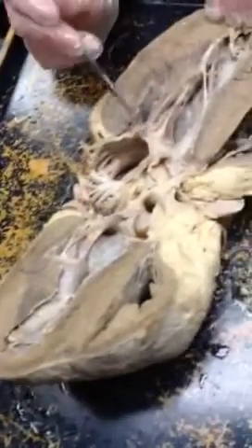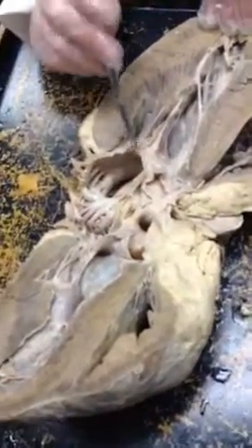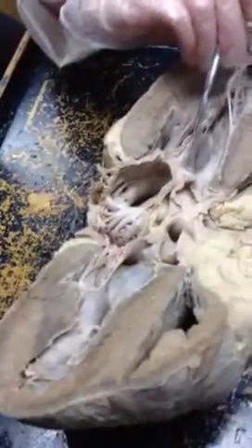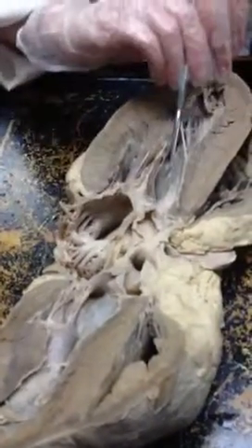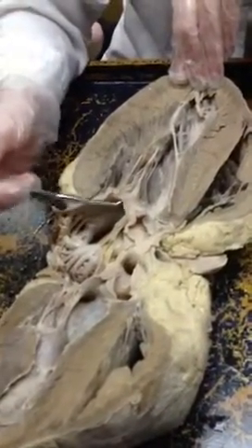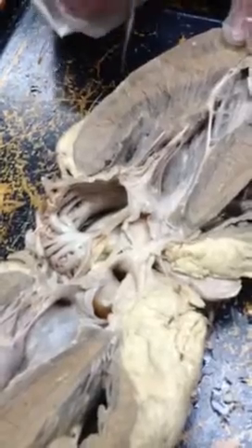For the valves, it's got to be on the fleshy part — more on the inside of the fleshy part rather than pointing outward, because up here is the aortic valve and we wouldn't put it on the outside of the valve. So here would be the bicuspid valve, and here would be the tricuspid valve. That little flap here is part of the aortic valve, as is that one, so make sure you're looking at the right valve.